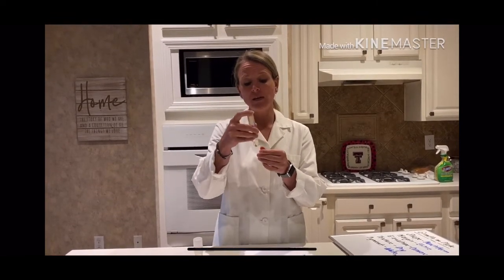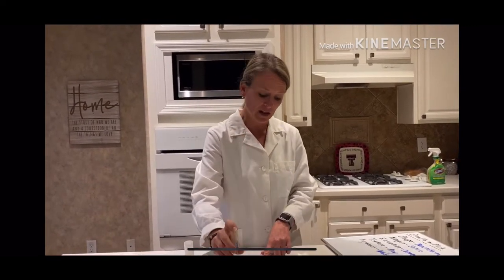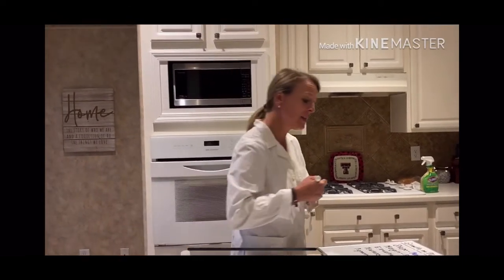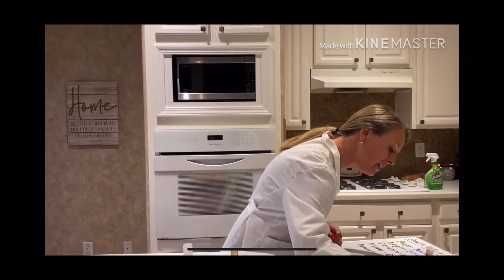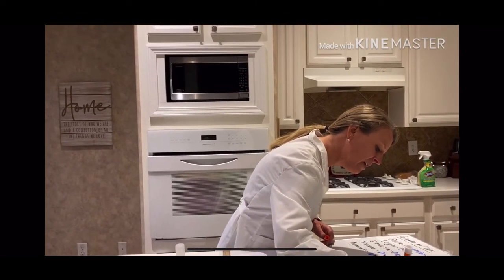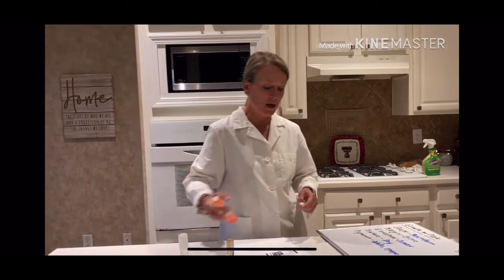So again, I'm just going to look at my broth, and then I would use one of these terms to describe what it looks like growing in a broth. In this case, mine sunk to the bottom of the tube. So we would say that the growth in the broth is sediment, and that indicates to me that it is probably anaerobic. So I'm just going to put anaerobic, question mark, out to the side, okay?